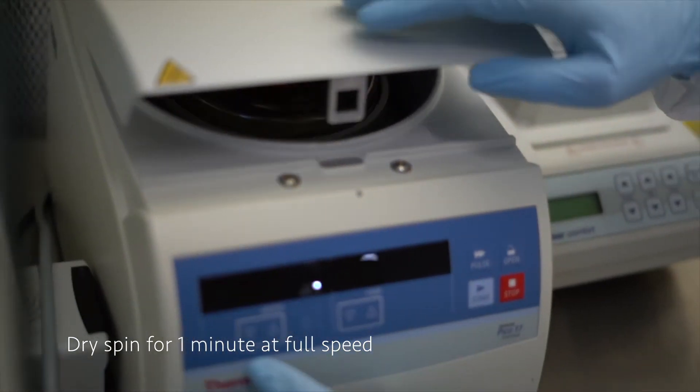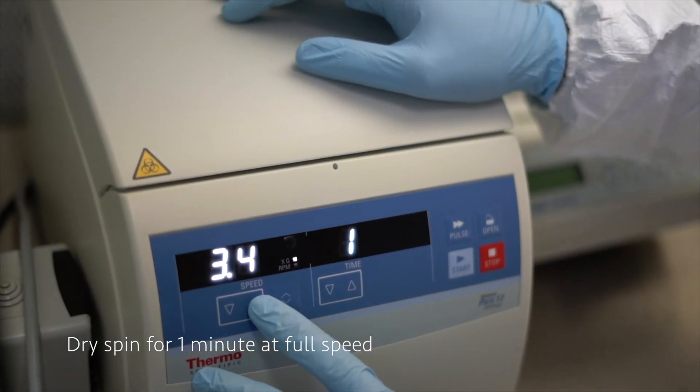We centrifuge at full speed for 1 minute.